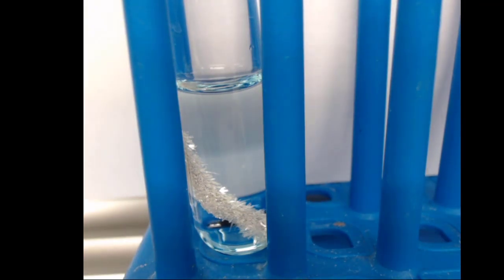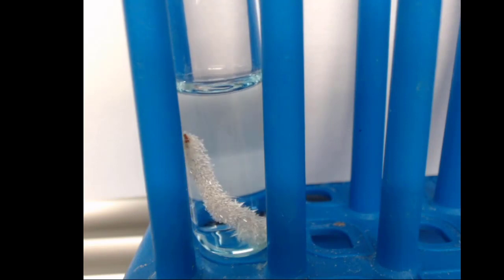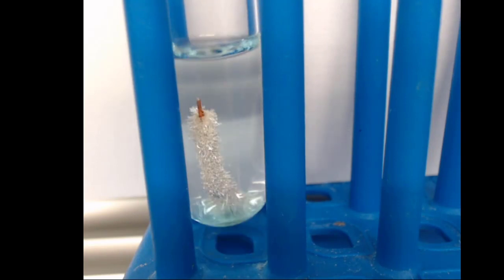And there's our redox reaction of silver nitrate with copper metal. What you have there are actual tiny spindles of silver metal. If we tried to take it out and collect it, you'd get a dust that is too fine to really collect. And honestly, the silver nitrate solution is more expensive than the silver you would get from it. But it is a really visually interesting reaction that occurs.